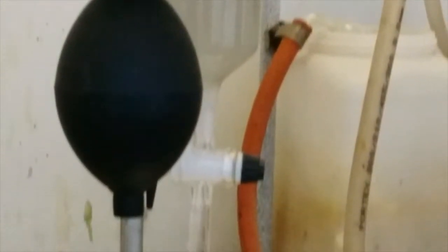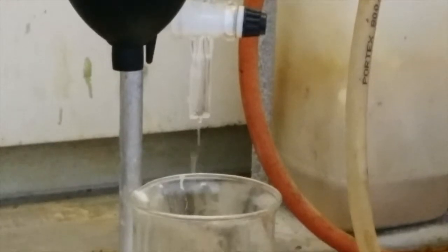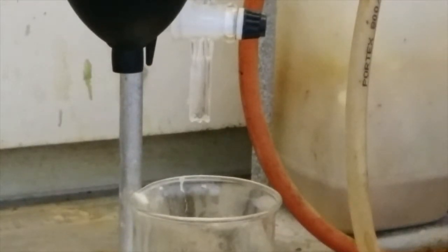If you're finding this tricky you can remove the bellows at this stage. This will allow the column to run under gravity rather than pressure and will slow the rate at which the solvent comes out of the column.